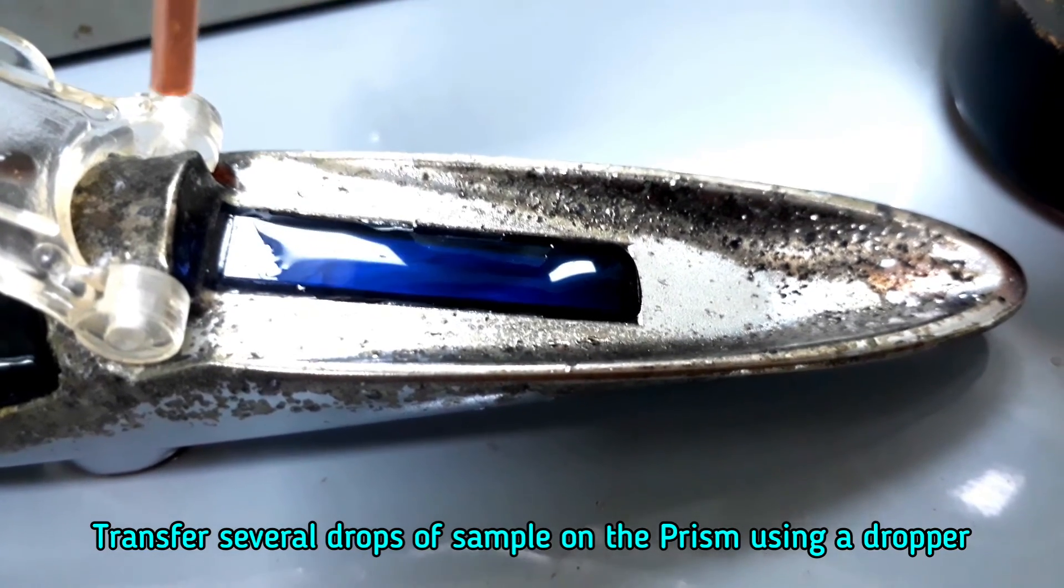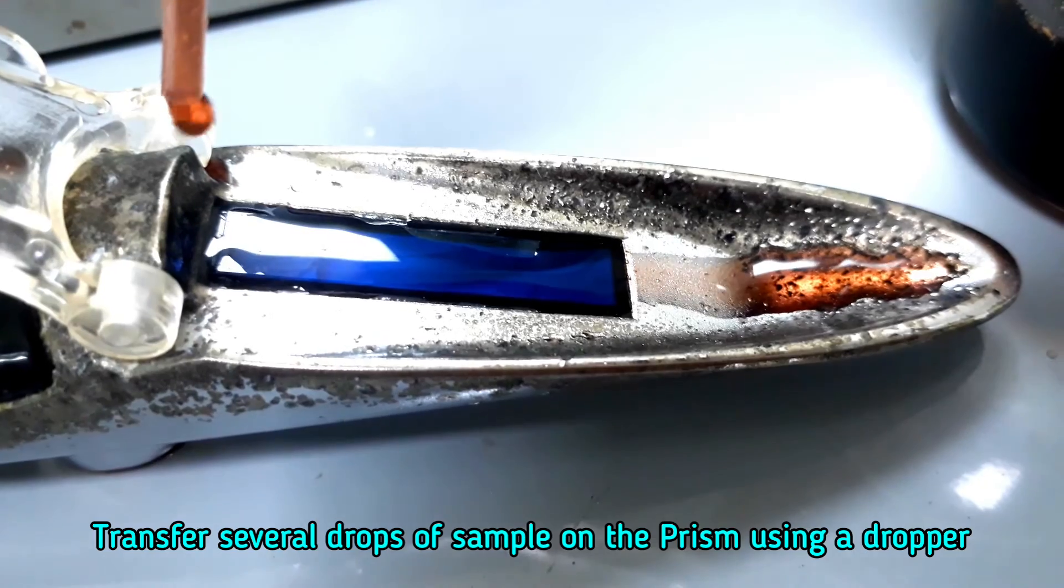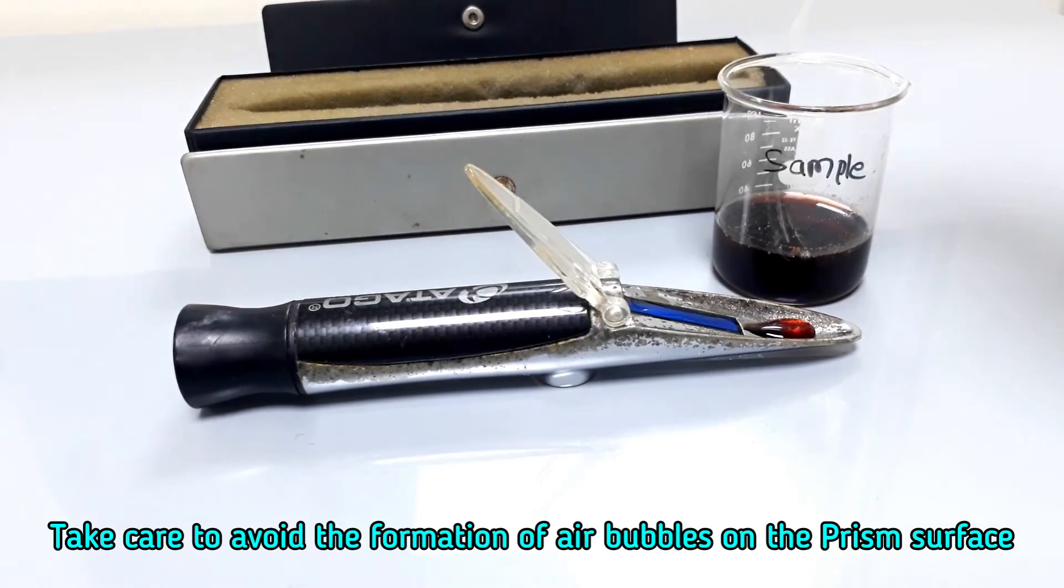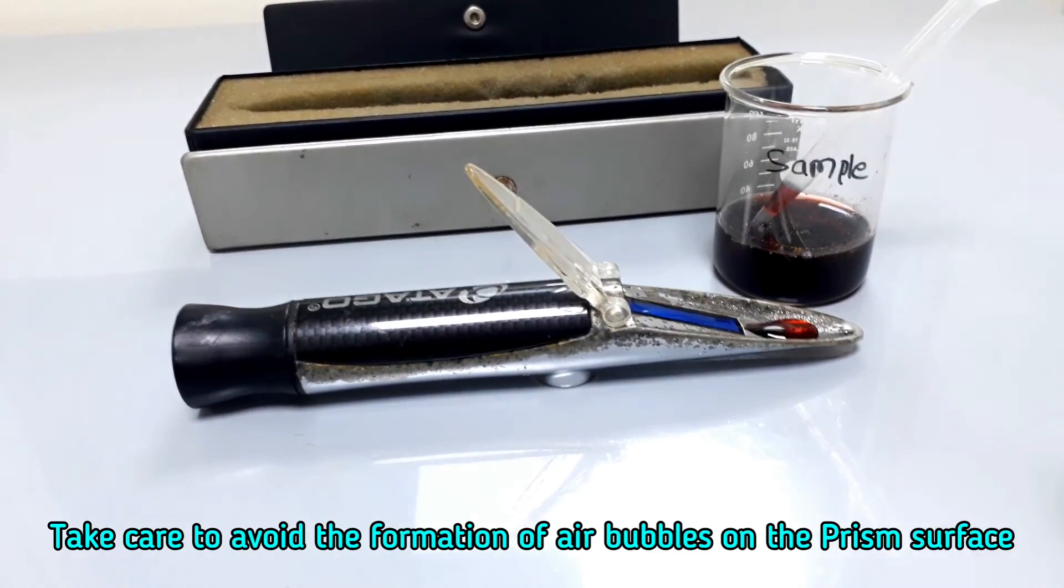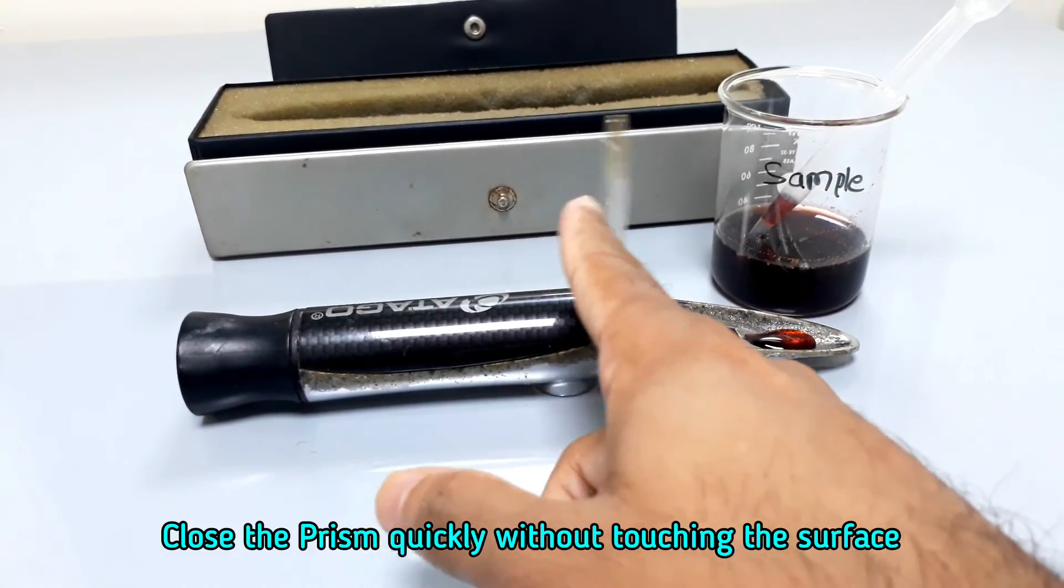Take care to avoid the formation of air bubbles on the prism surface. Close the prism quickly without touching the surface.